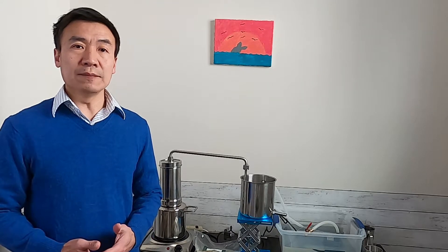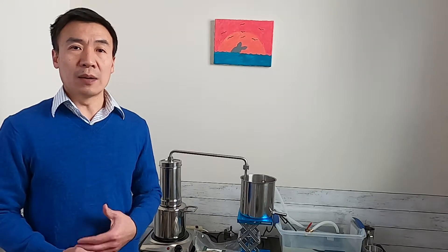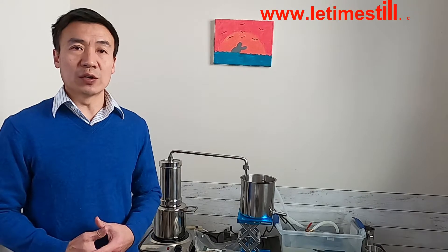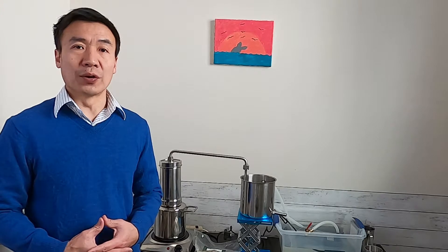Hello, this is Leo at LeeTime. In today's video, I'm going to do the steam distillation with rosemary. I'm going to make rosemary hydrosol and essential oil.